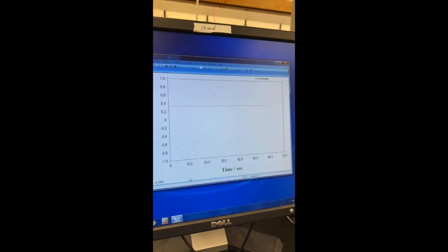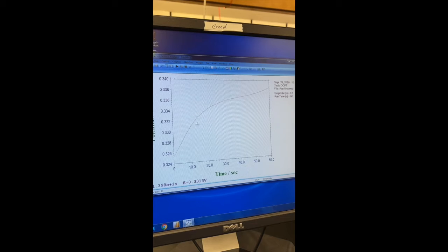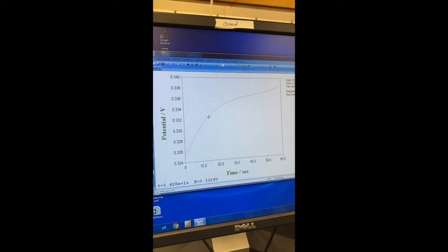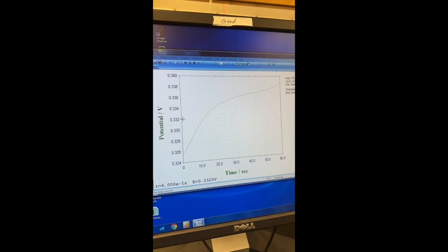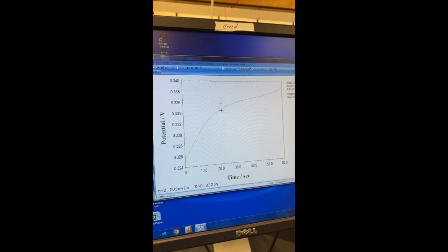We're done. So I'm going to click down here, kind of close the page and open it again, and we'll get a graph here. So this we can use to see what the initial equilibrium value is. So I'm going to find a point kind of halfway up this line, move across. So I'm going to say it's about 0.333 or so right in here. So I'm going to make note of that.